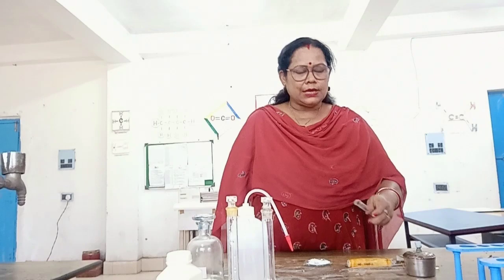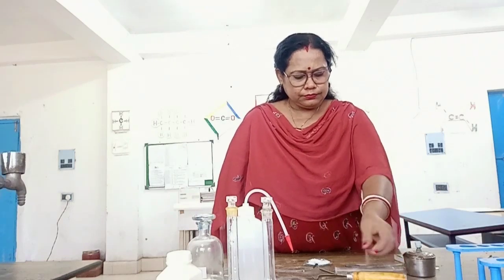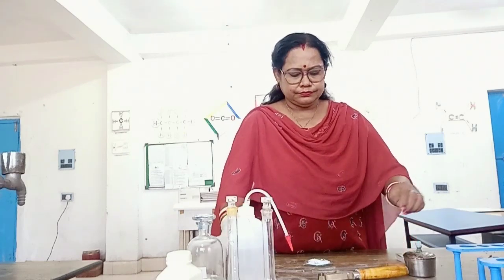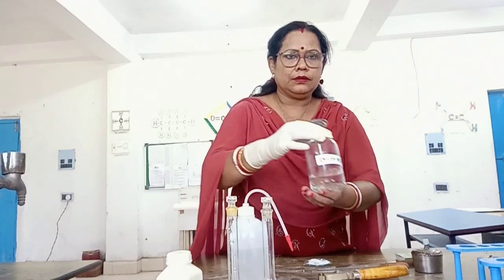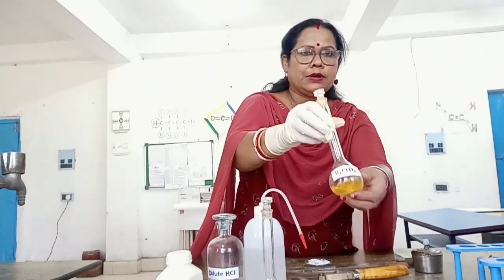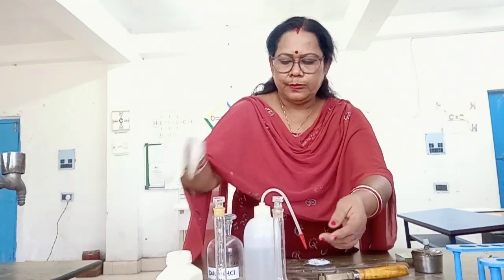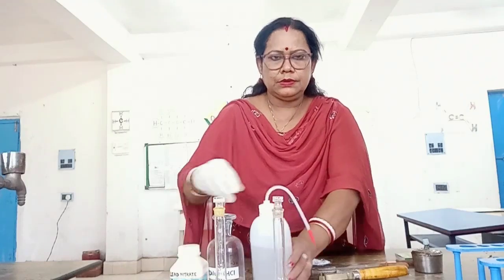For this test, the necessary equipment and chemicals are: test tube, test tube holder, dropper, glass rod, spatula, spirit lamp, dilute HCl, potassium chromate, potassium iodide, lead nitrate, and distilled water.